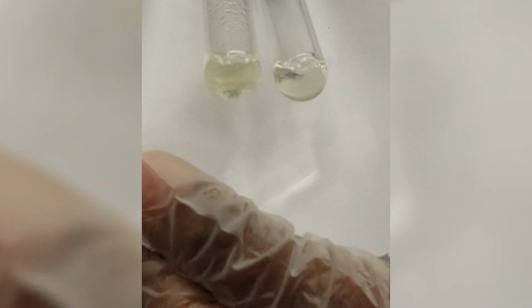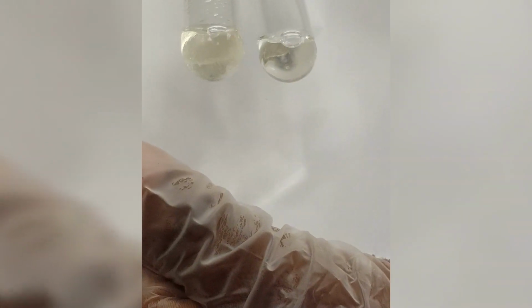Lastly, this is our unknown. Unknown in water. Is our unknown soluble in water? Do you see separate layers? Let's compare the solubility of our unknown in Ligroin. We can see that we have a mixed homogeneous layer of unknown in Ligroin.